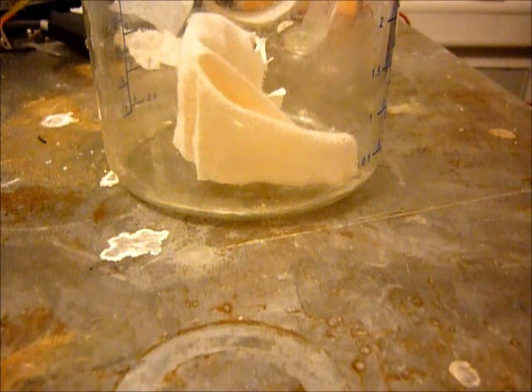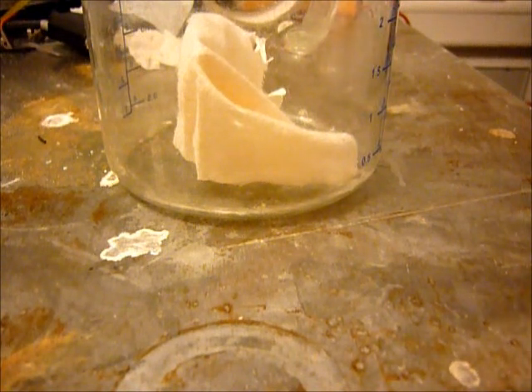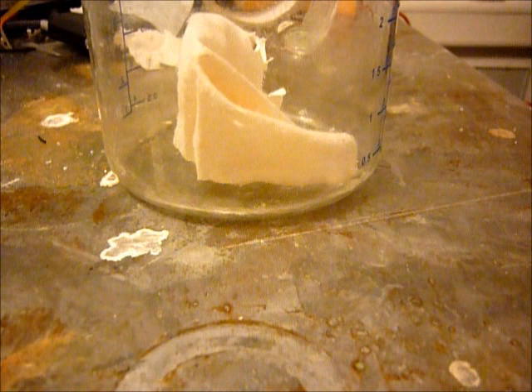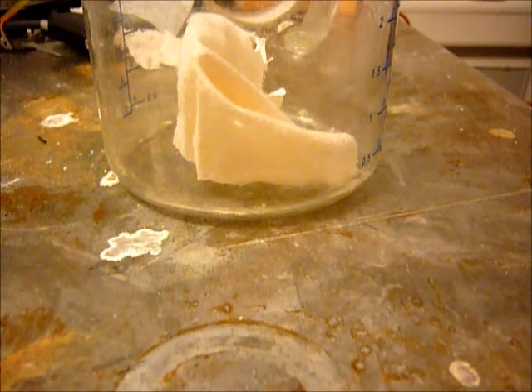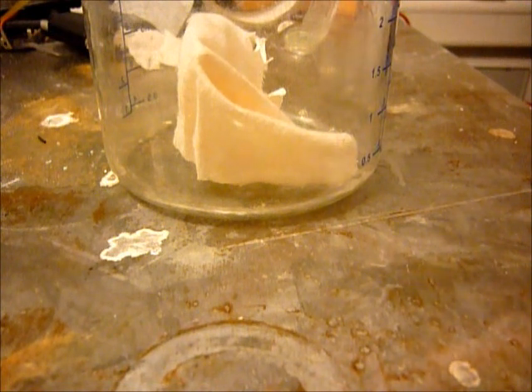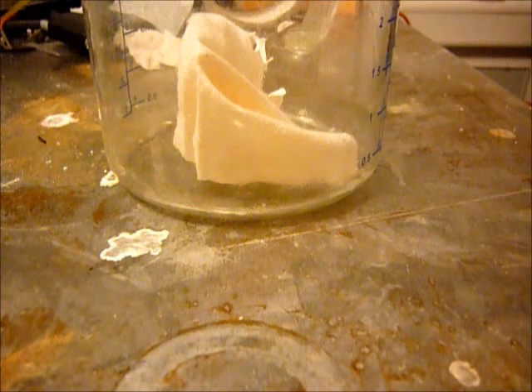So now the sulfuric acid will take this H2O from the glucose molecules in the cellulose and it will leave elemental carbon, and this will make a dark gooey paste.